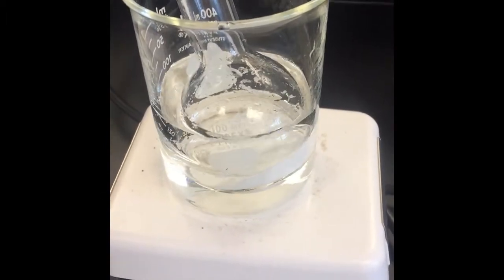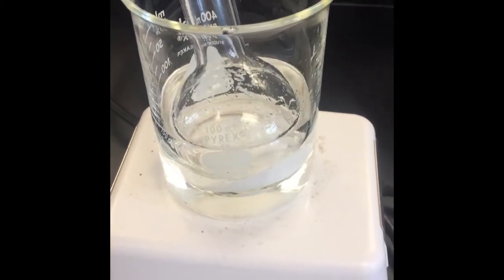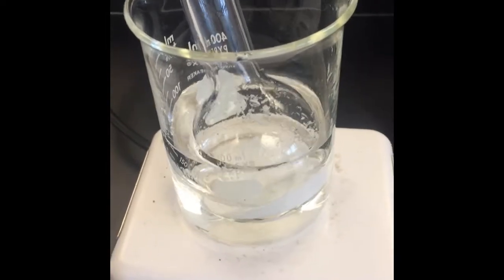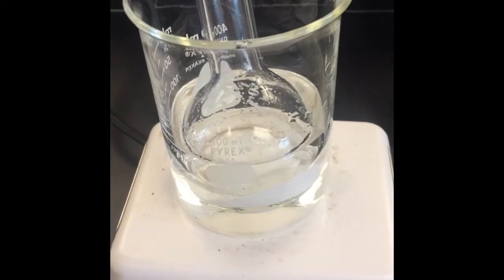Right now the magnetic stirring bar is basically stuck in the precipitate at the bottom, so rather than stirring in the middle of the flask it's just causing the whole flask to kind of bob around. That'll fix as soon as it gets hot and stuff starts to dissolve.